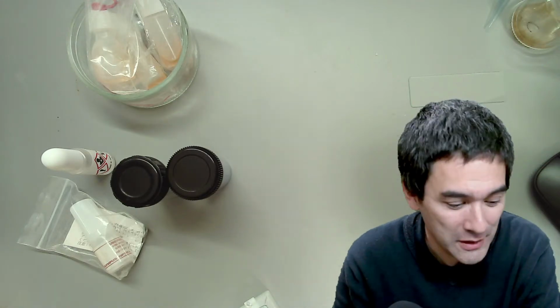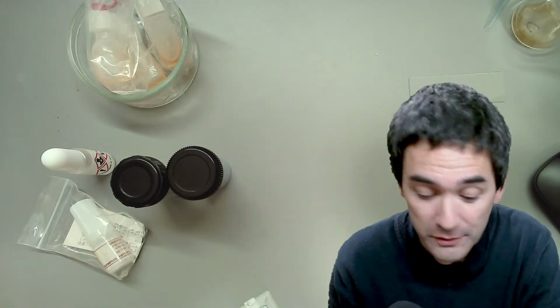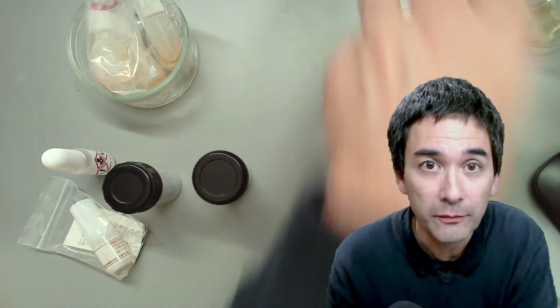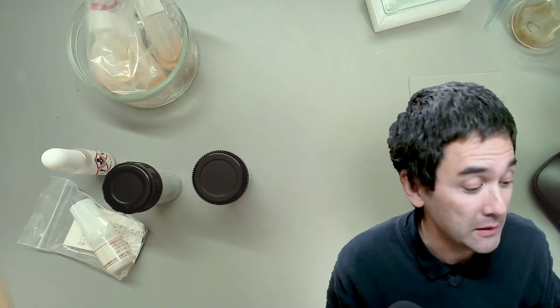Today I would like to talk about oil immersion microscopy. I'd like to show you how oil immersion microscopy works. I have prepared some specimens here, but I would like to do the following first. I'd first like to talk a little bit about some theory, for maybe about 20 minutes, simply to explain the background, and then we can put a few things under the microscope using oil immersion.